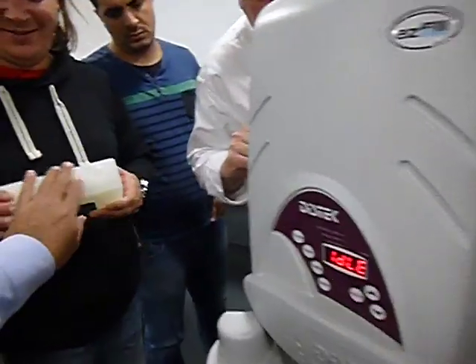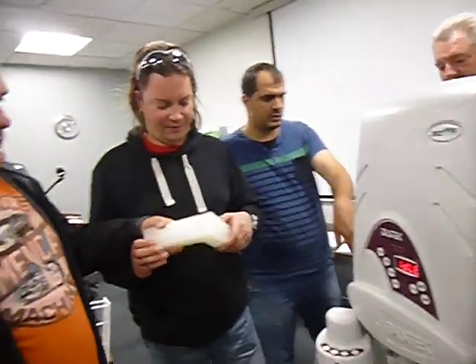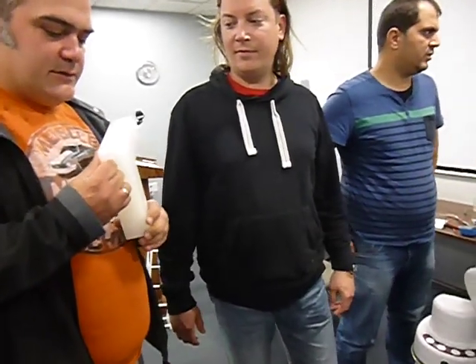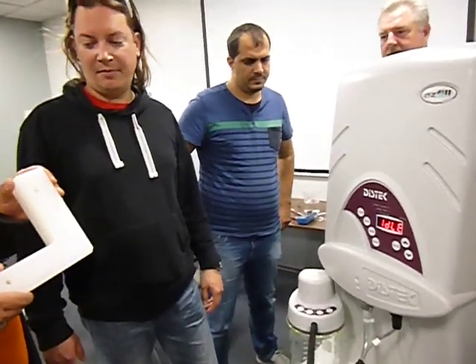Right angle. No Teflon. Both heaters are at the same temperature. And it's polyethylene. Polyethylene is too. Whatever you said. In the block. Right.